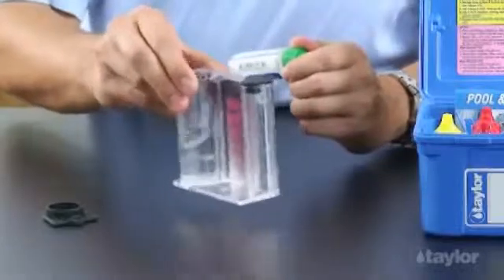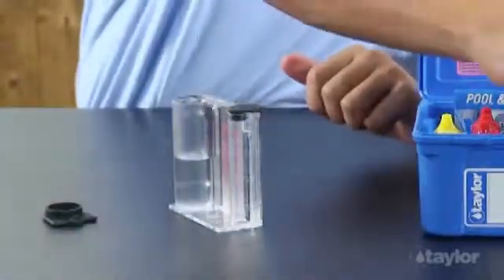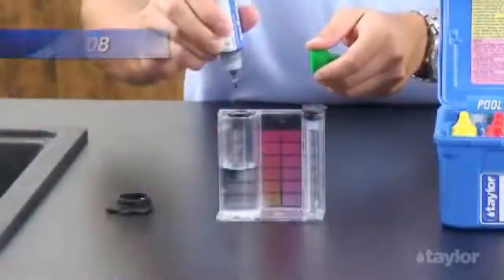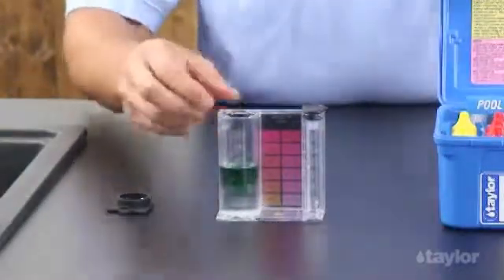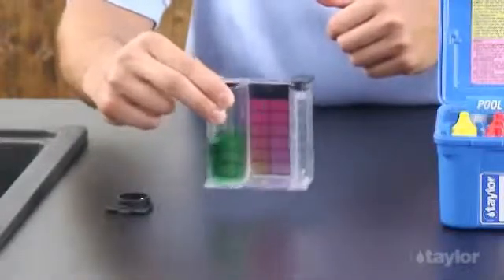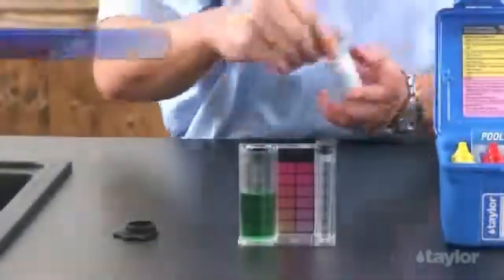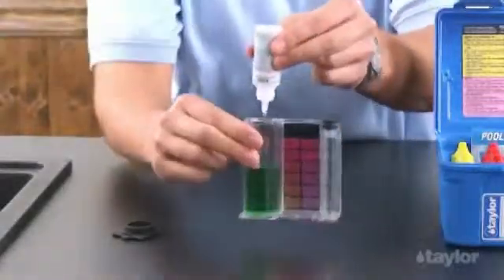Swirl to mix. Add five drops of reagent 8 indicator. Swirl to mix. The sample should turn green. Add reagent 9 dropwise — after each drop, count and swirl to mix until the color changes from green to red.